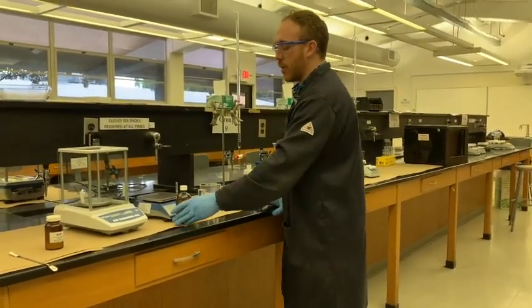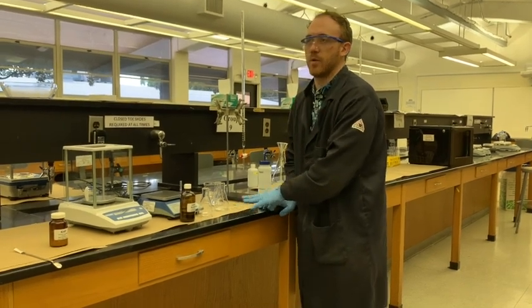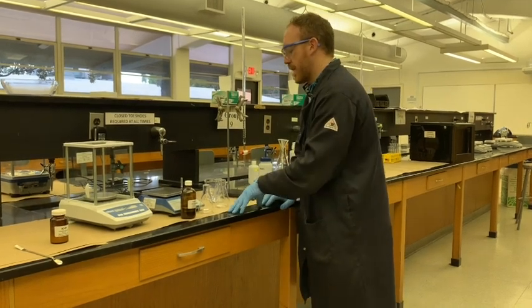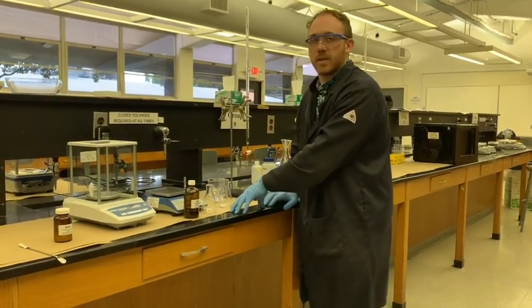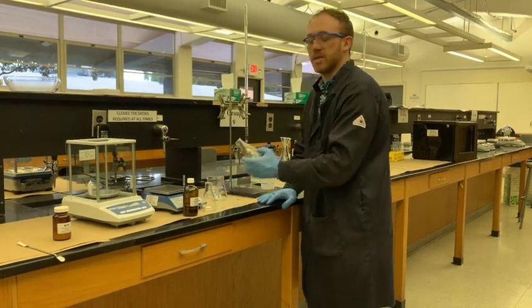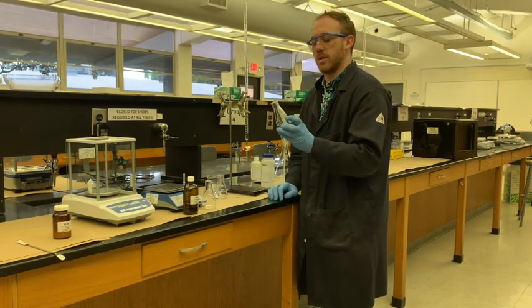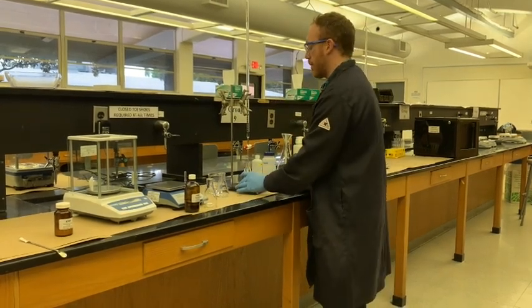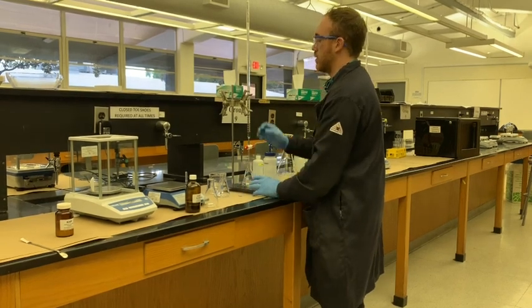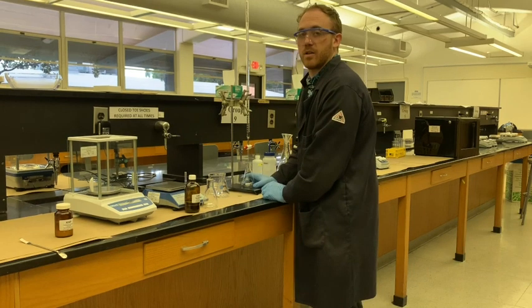And we have to go a little bit more carefully in using that NaOH because we don't know if it's going to take a little or it's going to take all of it. In that case, we're going to err on the side of using a little of the NaOH, and we're going to take some small samples of the H2SO4 and see how that goes. So first, we're going to go for about 5 milliliters of this H2SO4 solution, which I've already placed in this burette. And we're going to do it just like the other titrations.